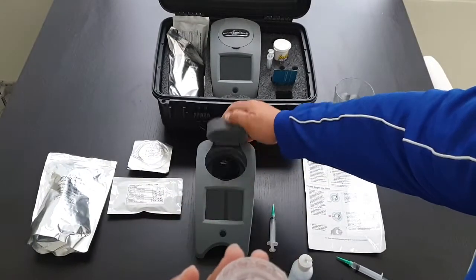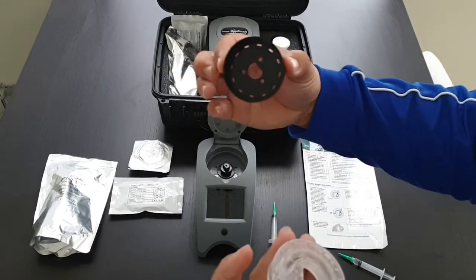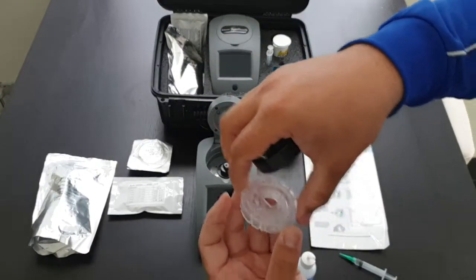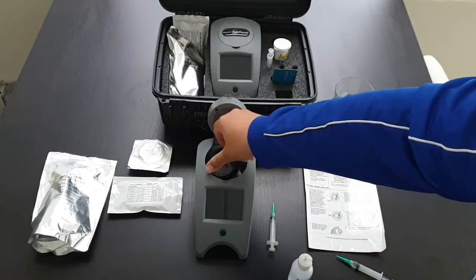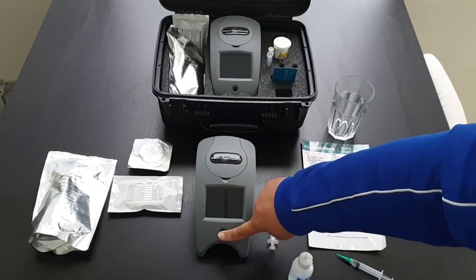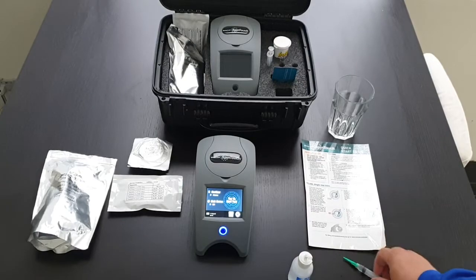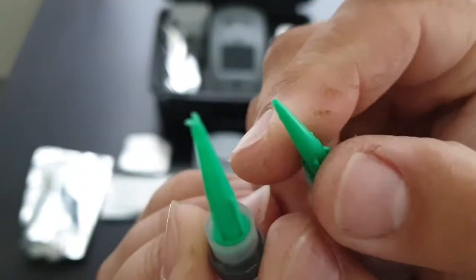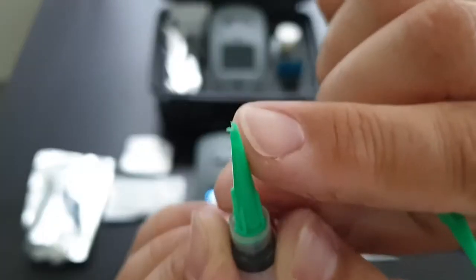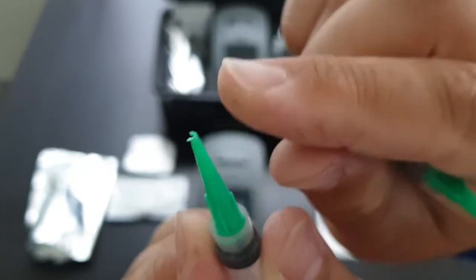So you open it, this has to go back on, then turn on. If you force the syringe head in you will end up breaking the syringe head.